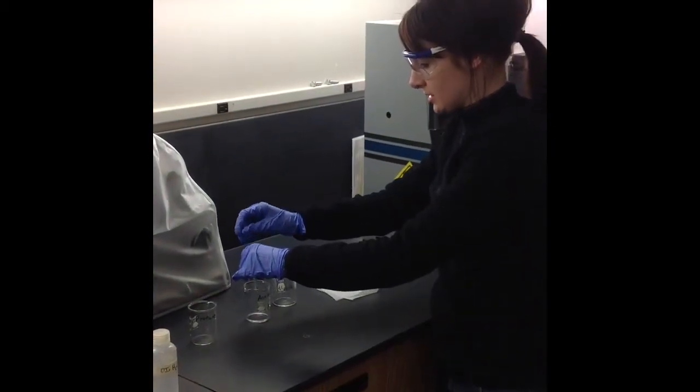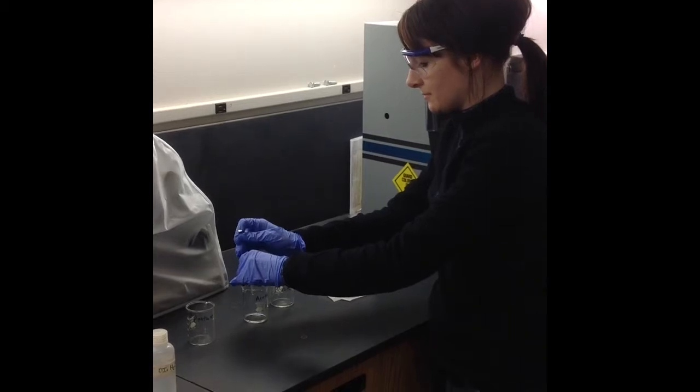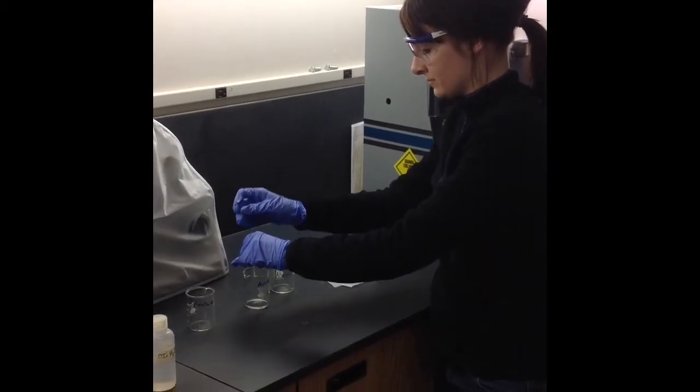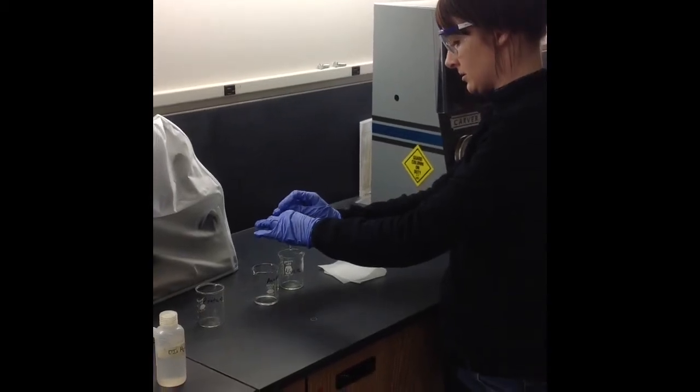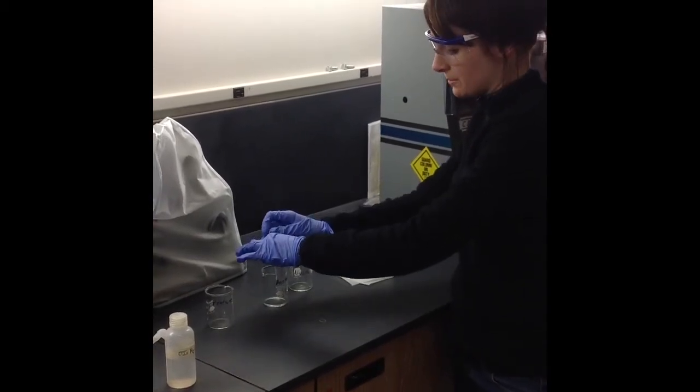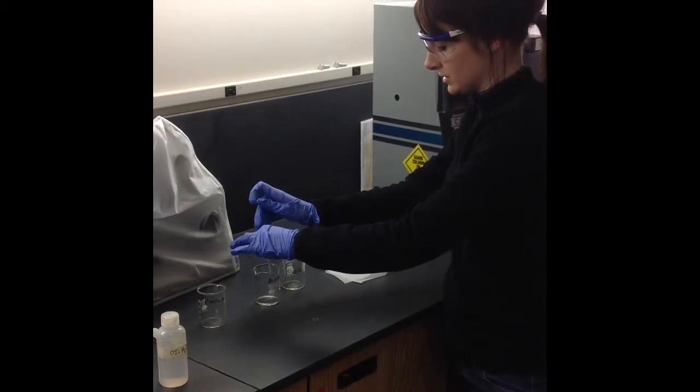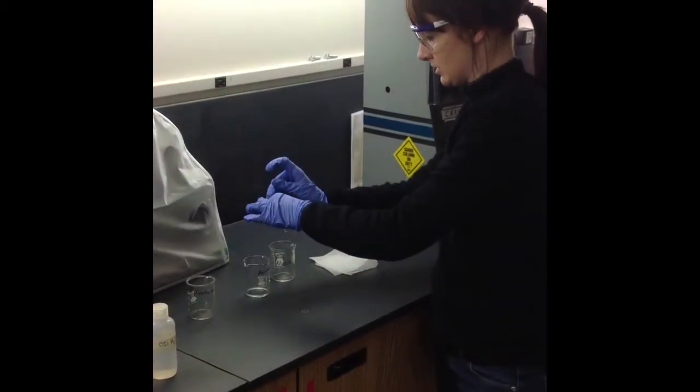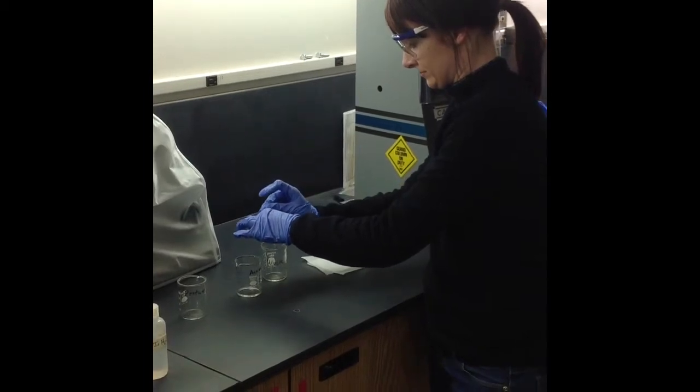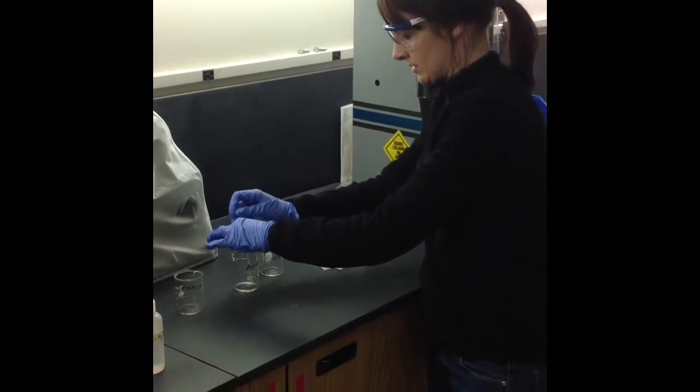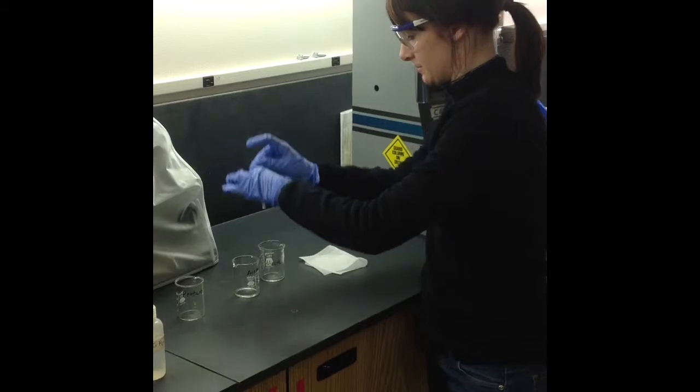Then you release it in the waste beaker. You'll probably see a drop or two come out. It's very small amounts for a total of three times.